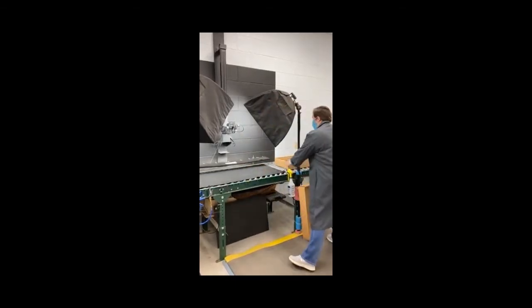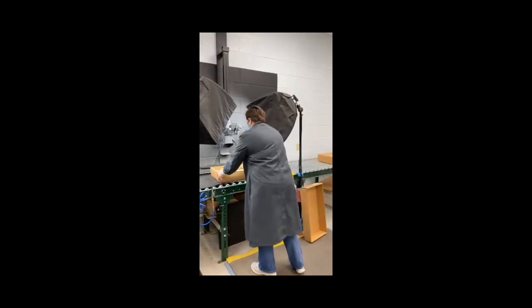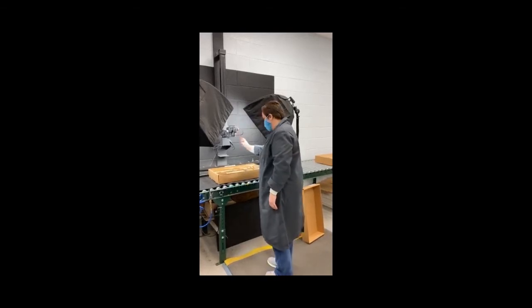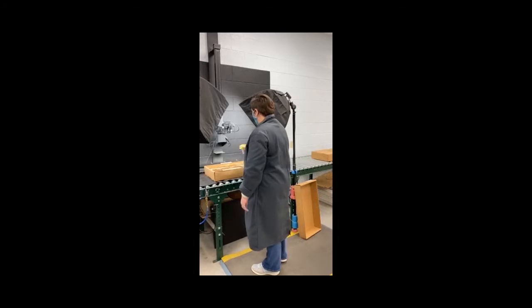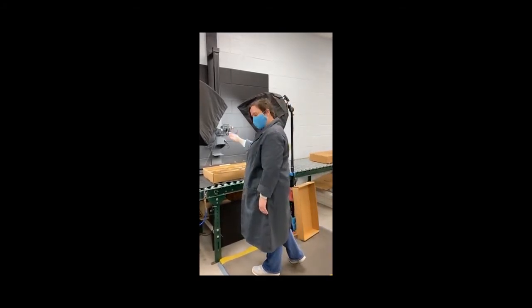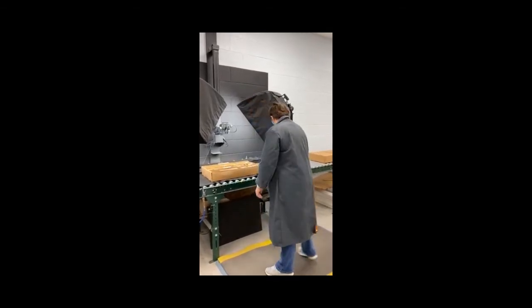When photographing core, we slide the first core sample box under the camera, adjust the shelf and camera, making sure the core is centered and fills the view area. The first picture is taken dry. Then for the second picture, we mist the core lightly with water to view the core wet. We do this to be able to see the core in detail without the dust and mud clouding our view. We label each picture with identifying information, then the sample is returned to the warehouse to be archived.